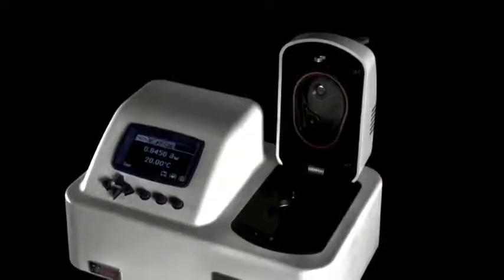Cleaning is an important part of making sure your Aqualab always gives you fast, accurate results.